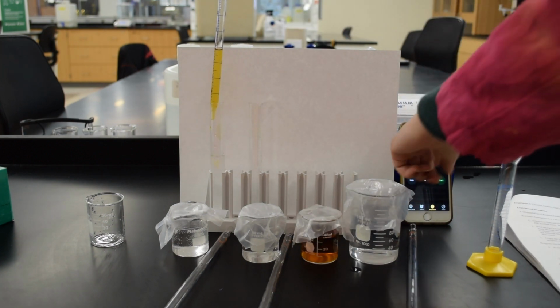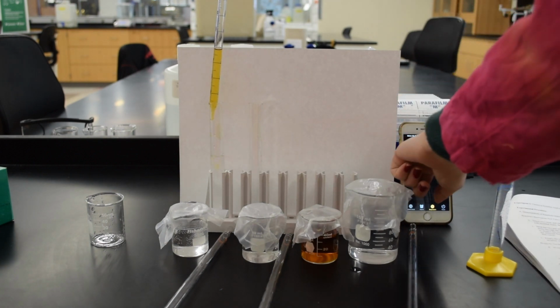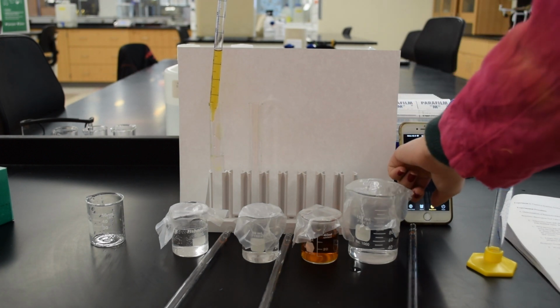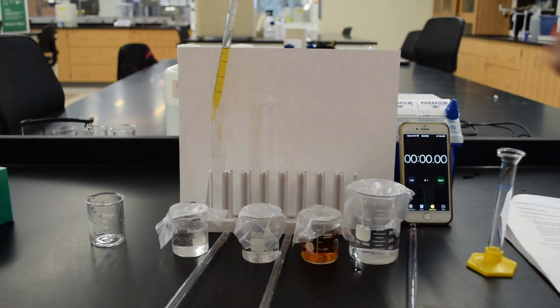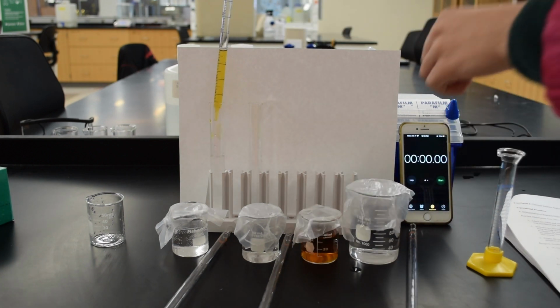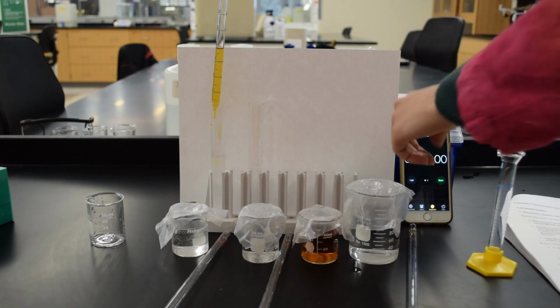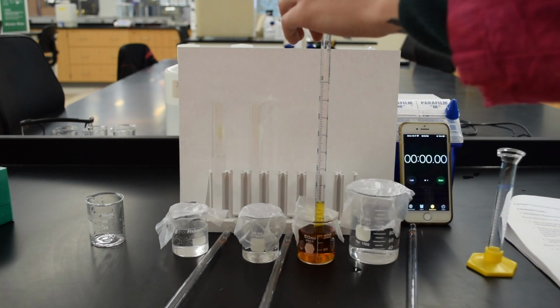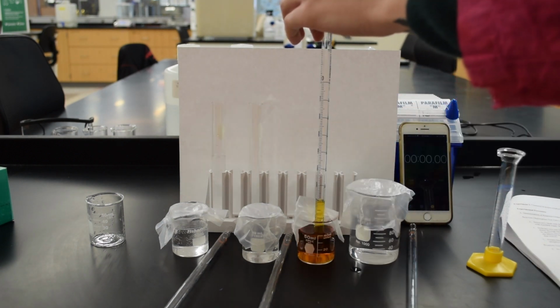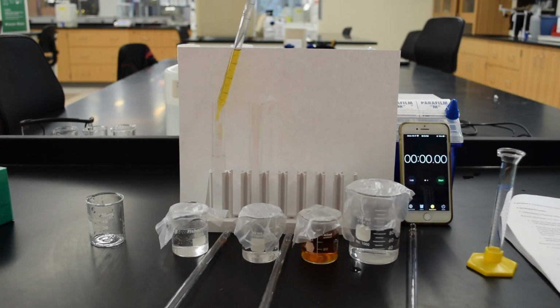Notice how we have all of our solutions laid out very neatly, and we are using one pipette for each beaker. That's actually really important. You don't want to contaminate your solutions here. If there's any contamination of the solutions, the whole experiment can get ruined. So you want to be very careful not to contaminate your solutions. So, okay, I will unfreeze time here and unloop things. I just wanted to point that out real quick.